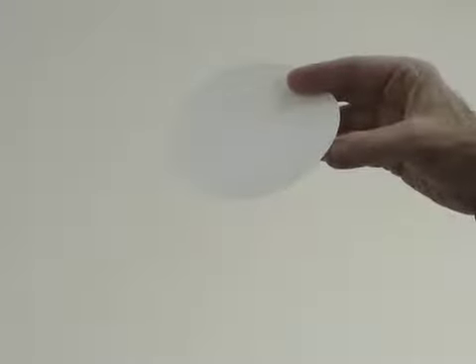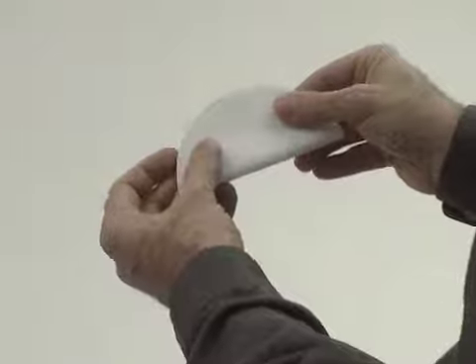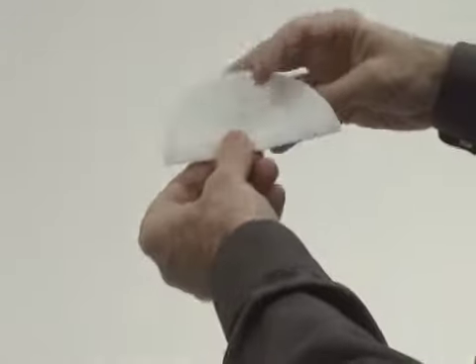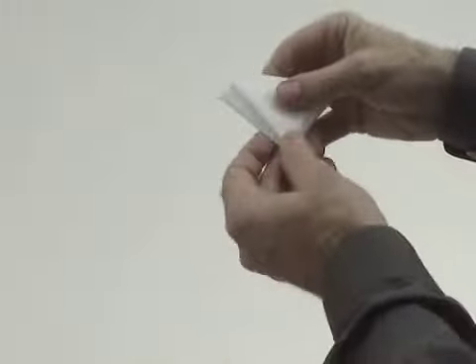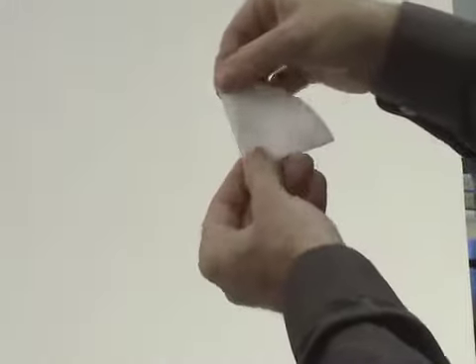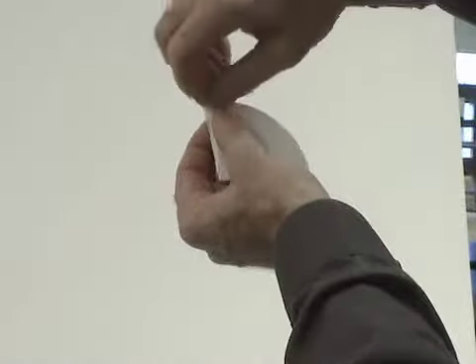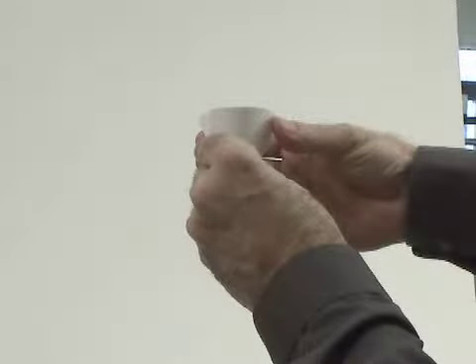Begin by folding the filter paper into a cone that'll fit into the filter funnel. This is accomplished by folding the paper in half twice. The second fold, however, will result in two not quite equal sections. In the shorter of the two sections, you're going to rip off the little corner at the top. This will allow the final cone to seat a little bit better into the funnel. Notice that the rip is on the outside of this cone that we make.